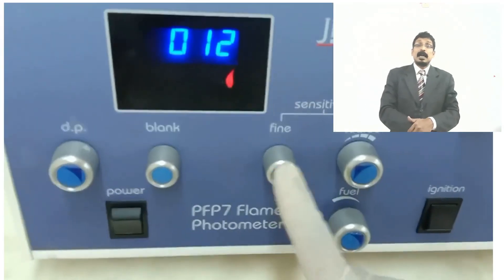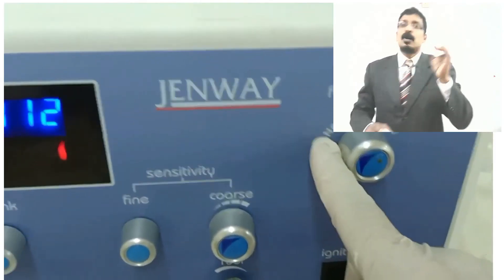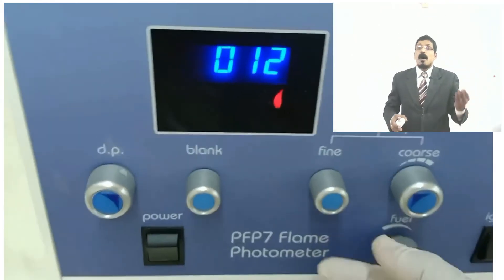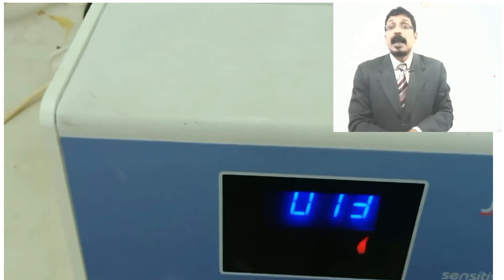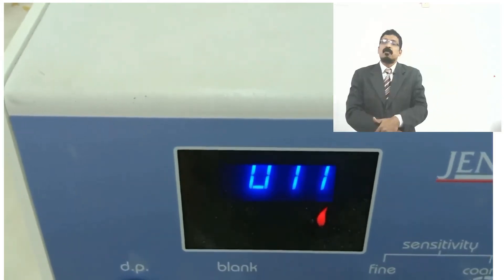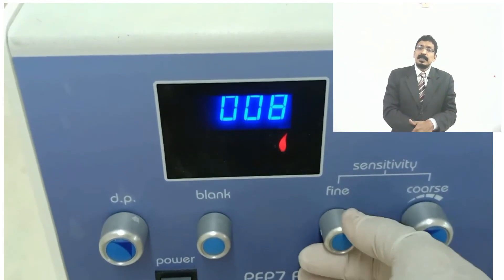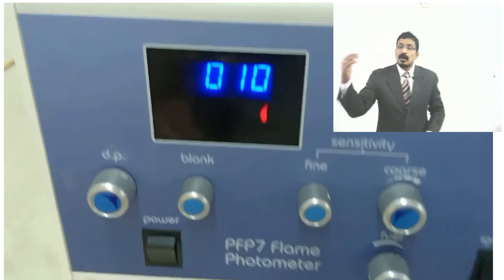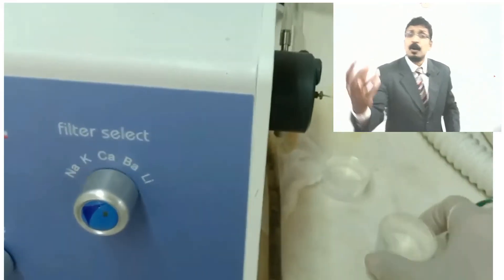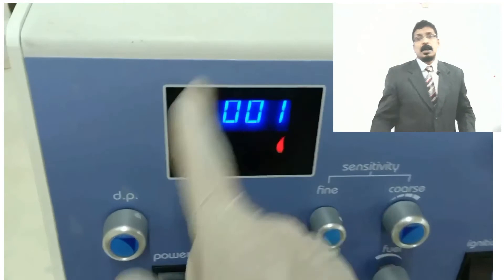Adjust the fine knob, set zero with double distilled water, then go for higher concentrations. After zeroing, take the highest concentration — use a small 10 mL beaker or a small standard flask — and record the reading. The difference between low and high concentrations is shown. Blank (double distilled water) is set to zero; if your instrument only has coarse and fine controls, no need to worry. Take distilled water, set zero, and use it as solvent for all dilutions.